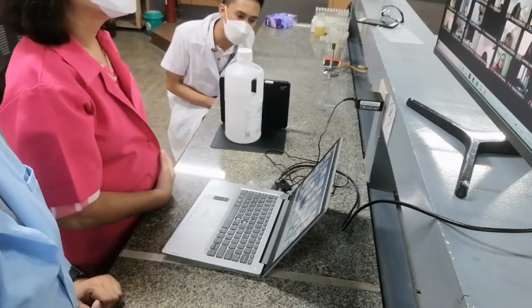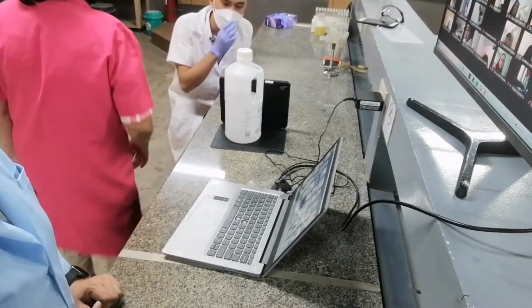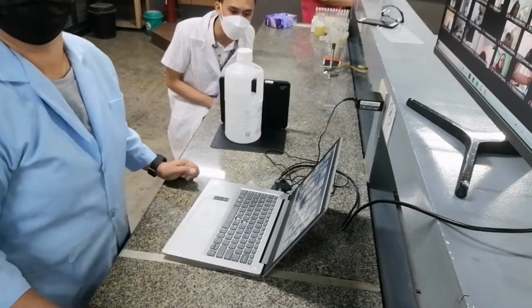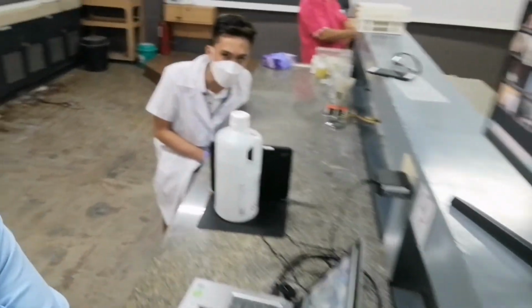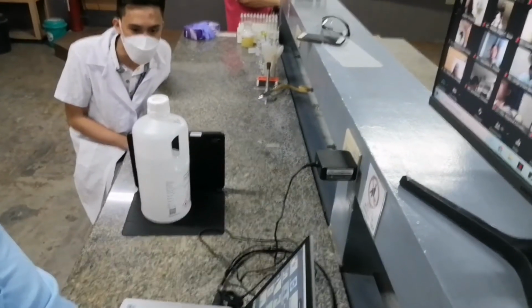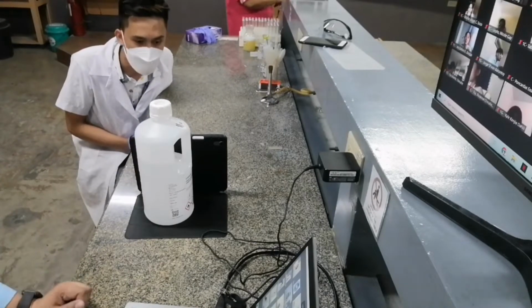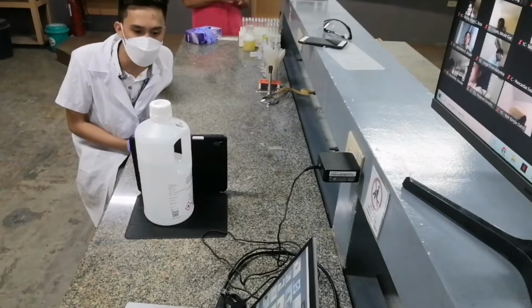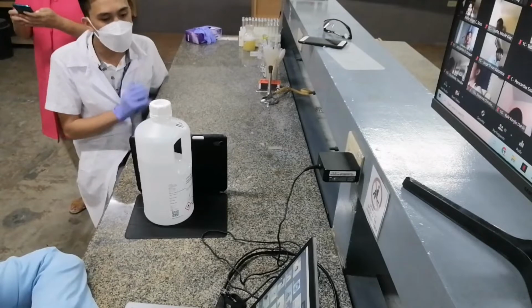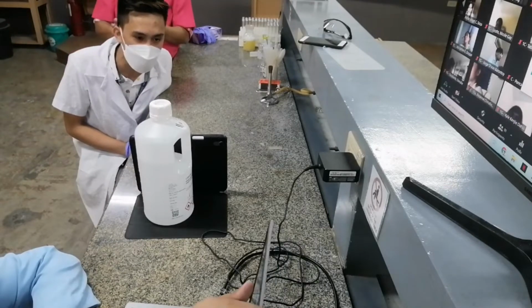So what we will be doing is the first part of ABCL number 5, diba? We've already uploaded the laboratory guide in your cello, right? Can you see it now, class? Have you seen your lab guide already for experiment number 5? It's the first part of the experiment that we will do. Specifically, we will do denaturation of proteins. Okay? Sige.